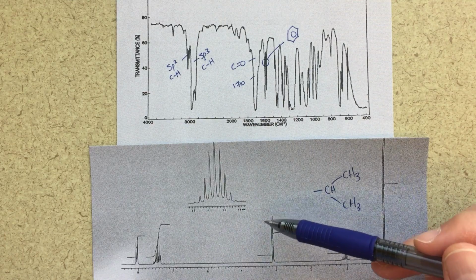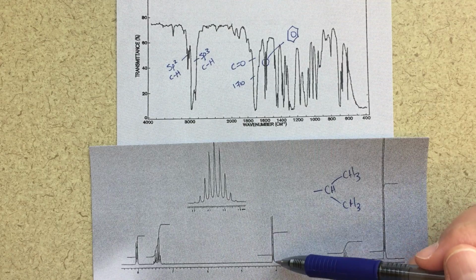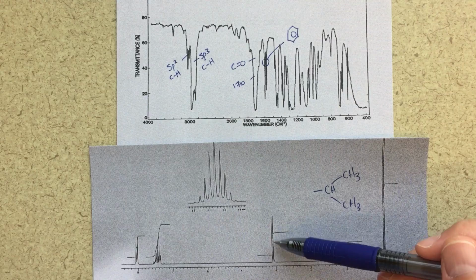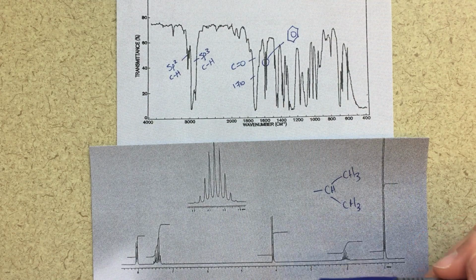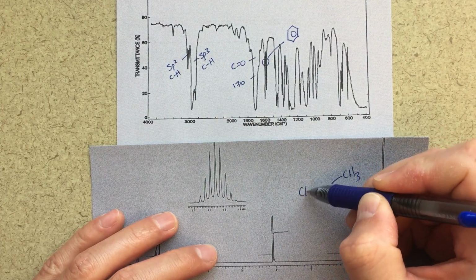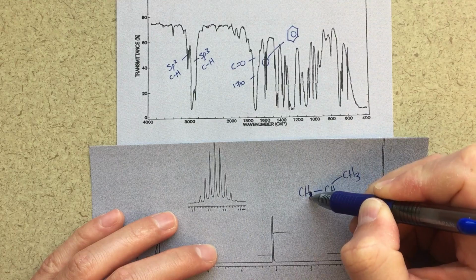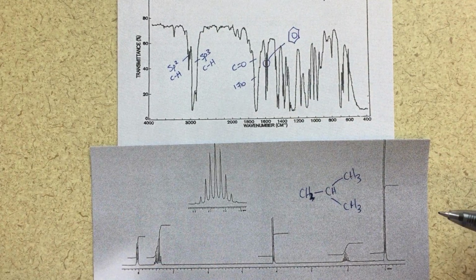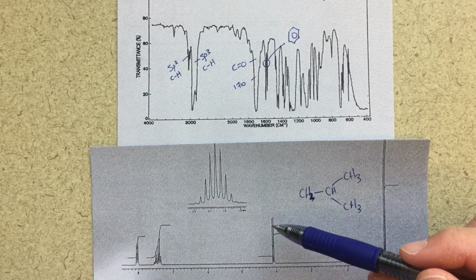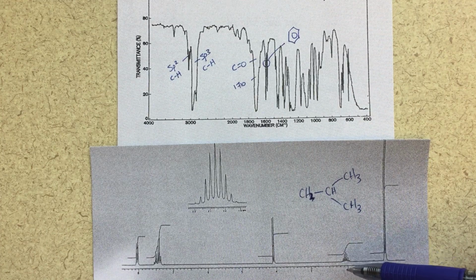Now this peak over here, this one I thought about for quite a little bit, because it should be CH2. So if I look at the integrations here, this would be 1. This looks like double. So I've got a CH2 group that's split into a doublet. So putting a CH2 group here makes a lot of sense. Oops, that should be a 2. CH2, got a little carried away there. Putting a CH2 group here makes a lot of sense because it would be a doublet because of this CH. But I'm a little concerned by the splitting, right?